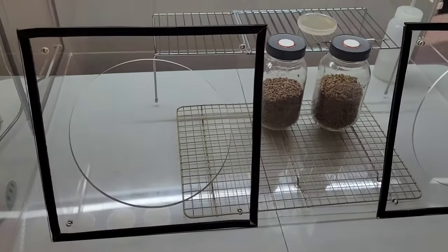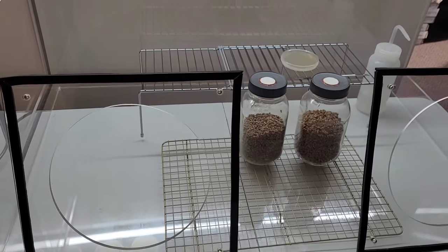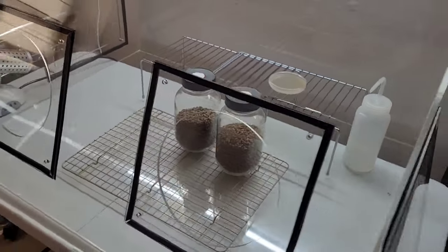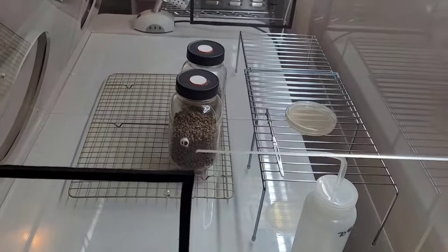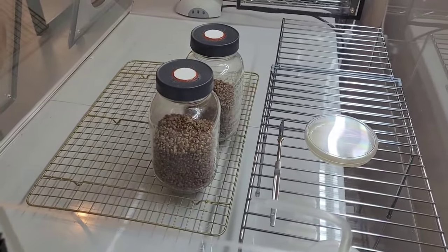You don't want to kick up any previously airborne particles that have settled onto the floor of your still air box through unnecessary movements, creating disturbances that could deposit mold spores or whatever else that's in here into your sterile dishes.